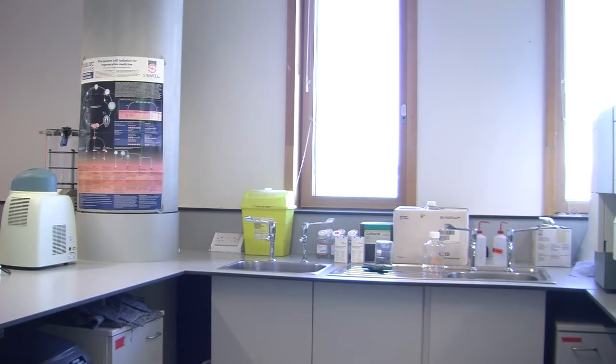Now, I will show you something. You may or may not be able to get this. I'll show this to everyone. I'm not a huge fan of vortexes. They can be quite harsh on the cells. They can break up some of the cells, and if you're working with small samples, small cell numbers, you don't want to break up your cells. So to resuspend them, I'll just take one of your tubes. The way I like doing it, you hold the tube, and you flick it across the bottom.